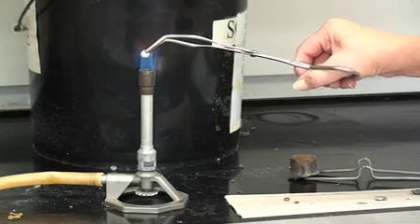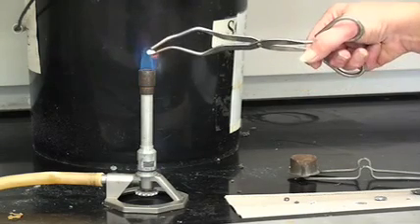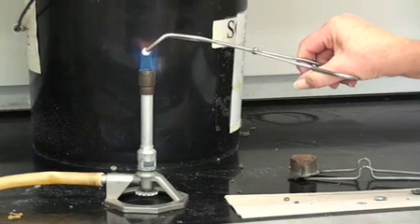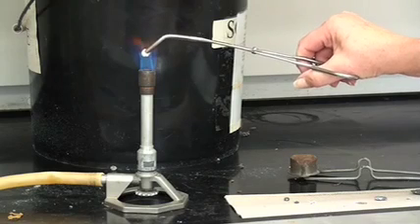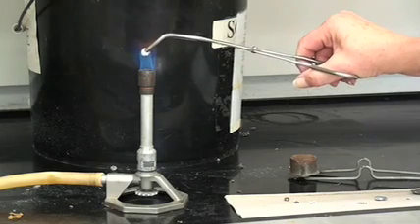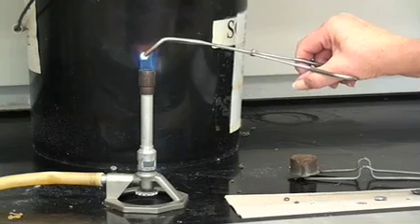We'll do this for a little bit longer. It is turning white on the surface. But I think you can see that the reaction is definitively slower than it was with the other two.